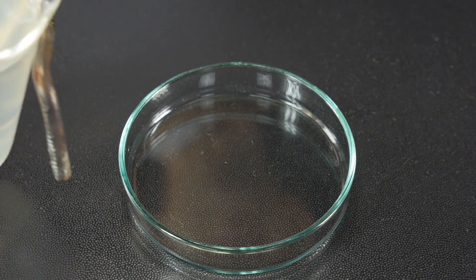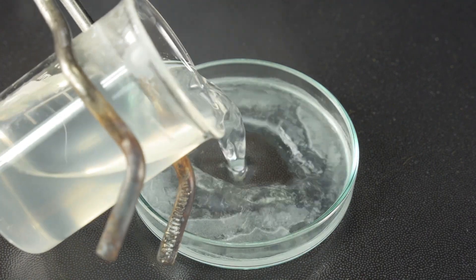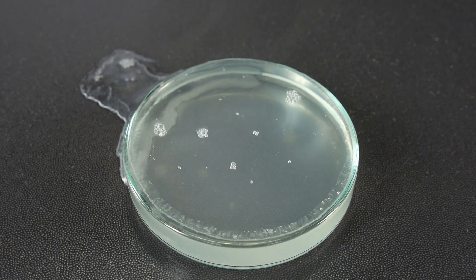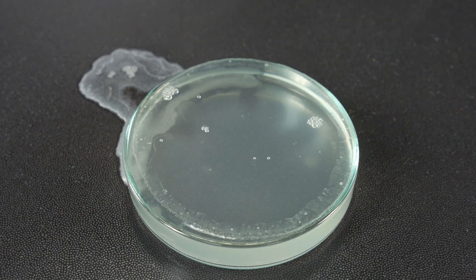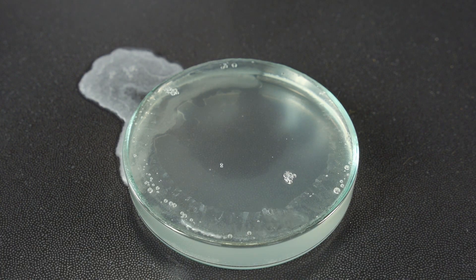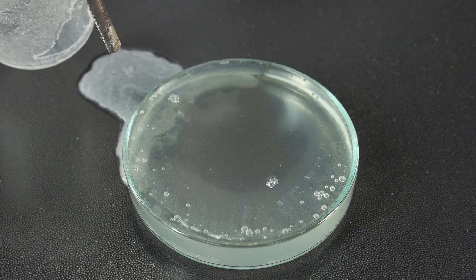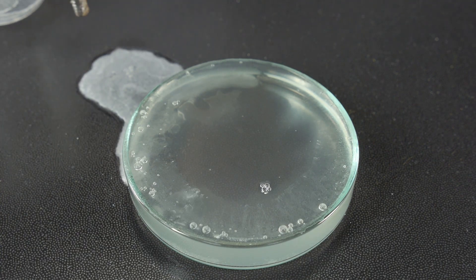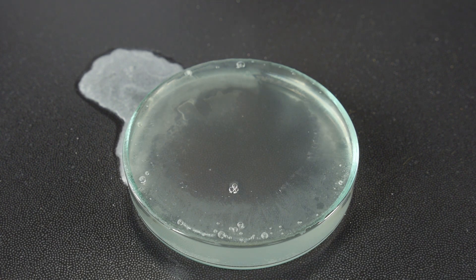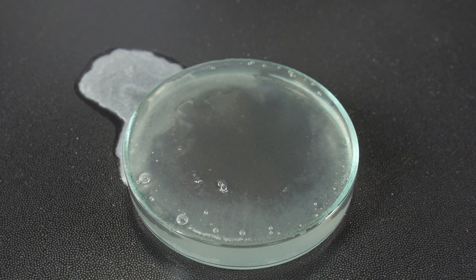And now I am going to pour the solution into this glass petri dish. I have spilled a little. Observe how the part that has been spilled has almost crystallized already, since at a lower temperature it is not possible to maintain so much dissolved solute.